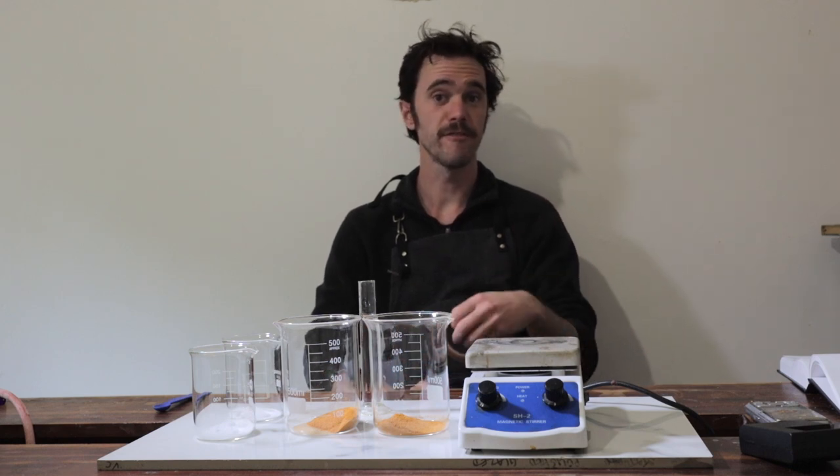We're going to try a few different approaches with this lake, mostly using the chalk as our precipitation method, but we may also use a bit of traditional sodium carbonate. We're going to go through the process of acidifying one mixture and not acidifying the other to see if pH extractions have a factor in determining colour outcomes, because we know that an alkaline solution can tend to cause deeper colours, while an acidified solution will create a different effect.